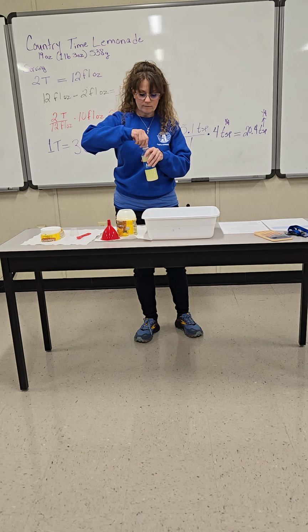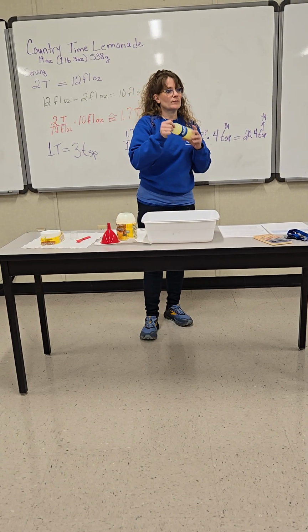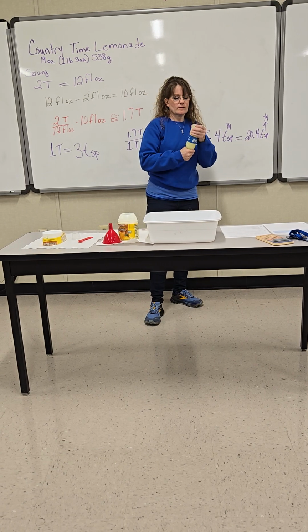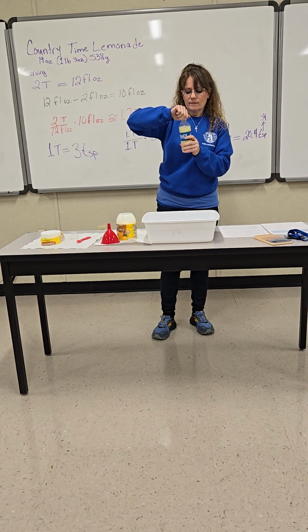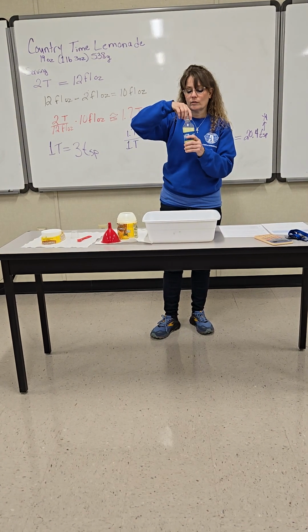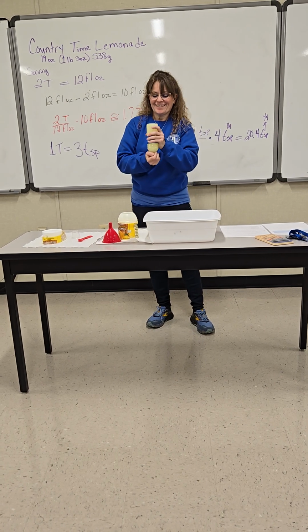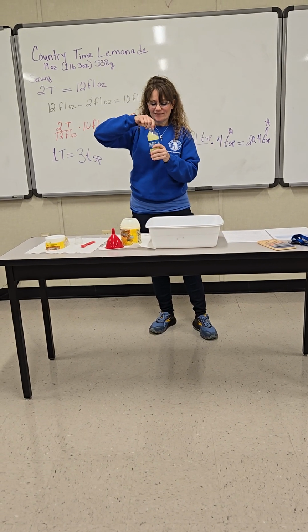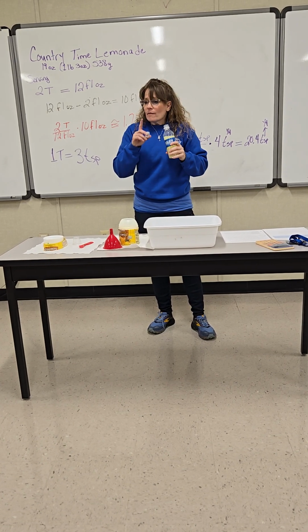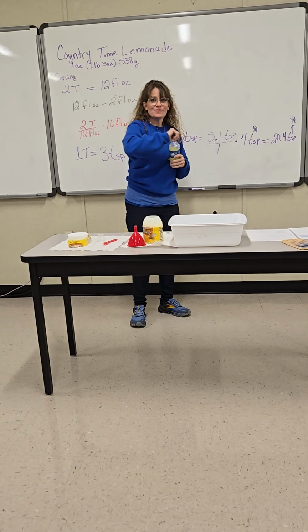Don't lose your read. So here's the test. We're going to determine if I should have rounded up or should have rounded down, which I know 0.4 is not 5 or bigger. But I could have done one more scoop. Let's make sure it's shook up good.